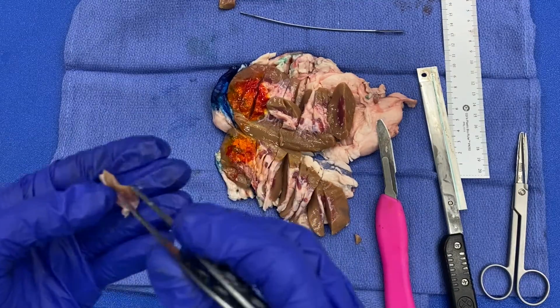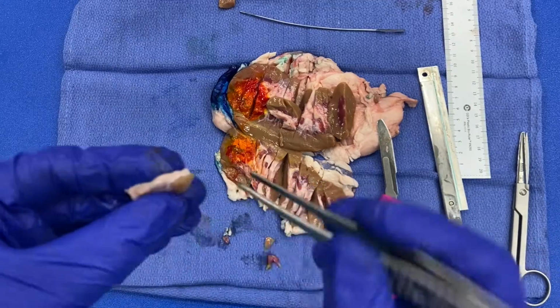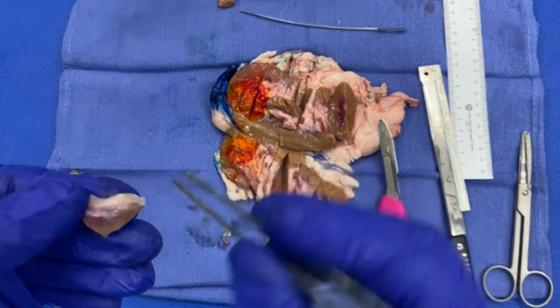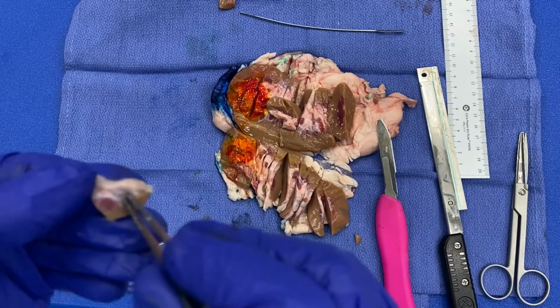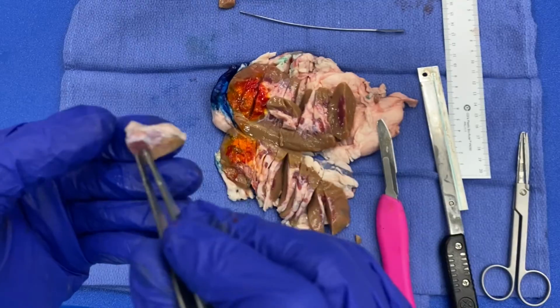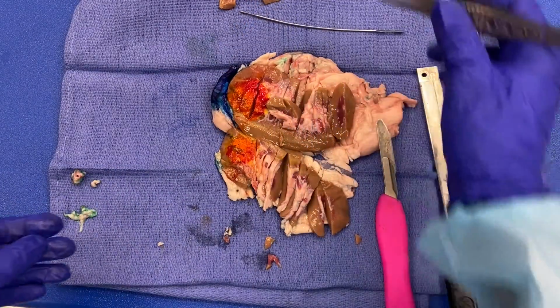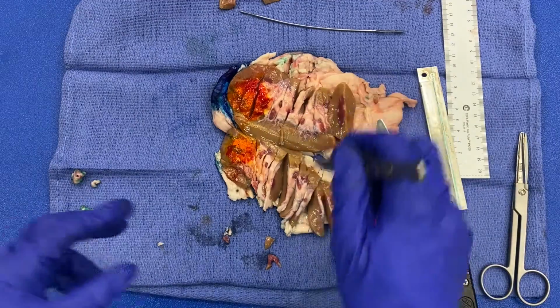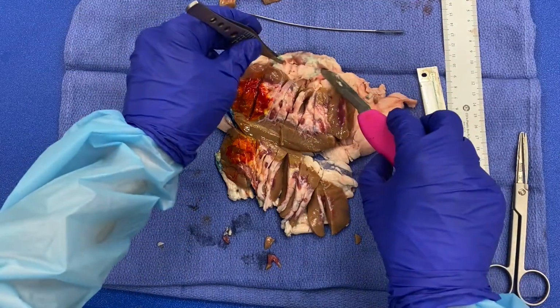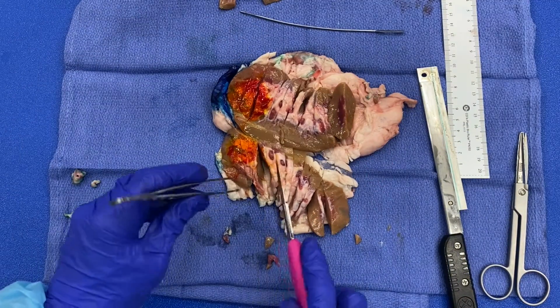All right. Double check. Looks pretty good now. So I have my urothelial mucosa here. I have underlying adipose tissue, which is part of my renal sinus fat. I have a nice section with medulla and cortex. So that will be another uninvolved section. All right. And then I will go ahead and start taking my important tumor sections.